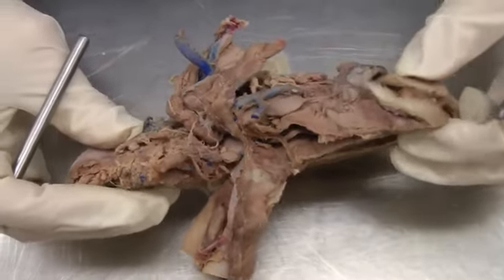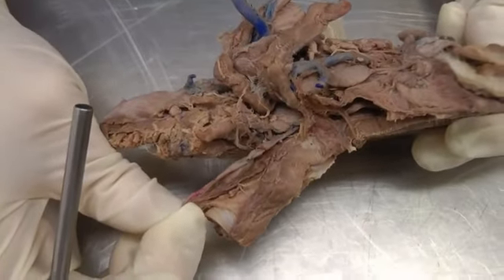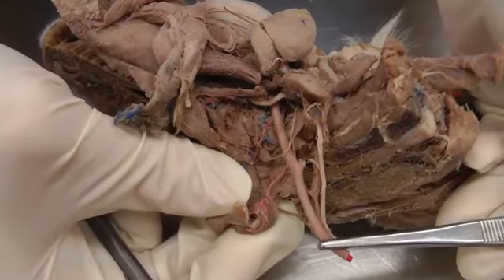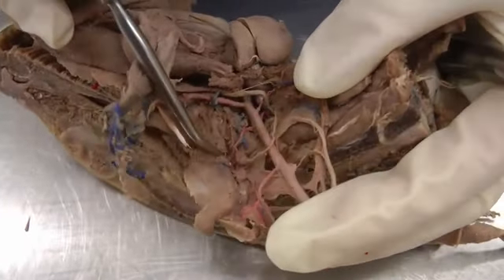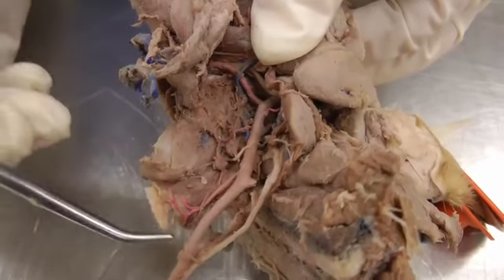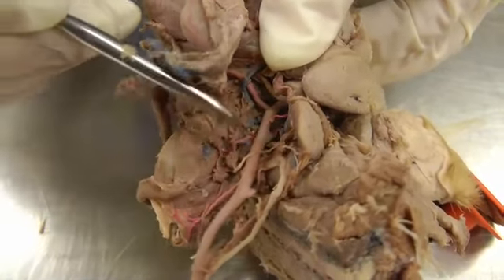And now we're going to move on to the common carotid artery. And so as you can see on the right side, it doesn't have injection. So I've done most of this on the other side of the head. Common carotid artery. And follow it along and see what we can find. Cranial thyroid would be here, and our other piece of thyroid is actually right here. So cranial thyroid artery there.